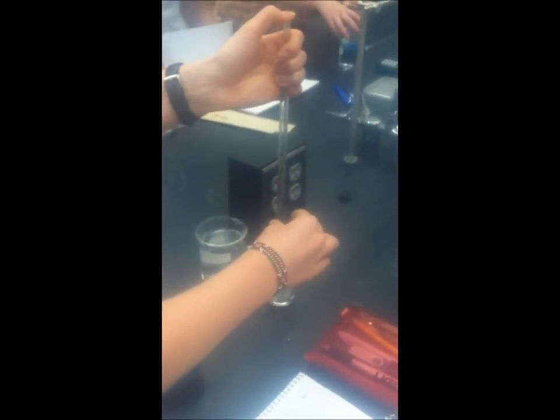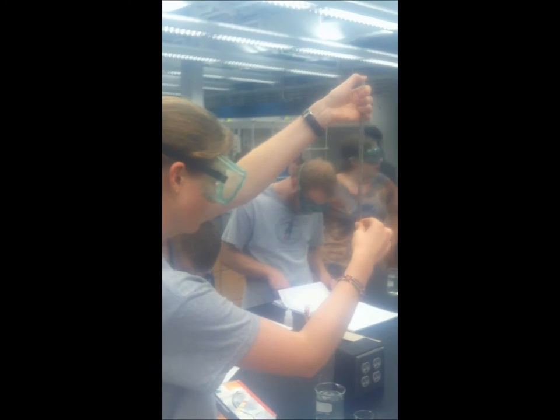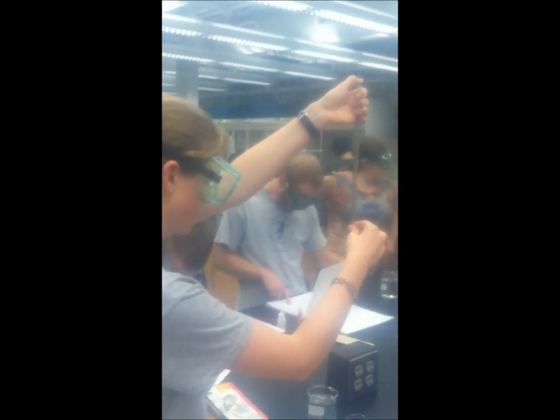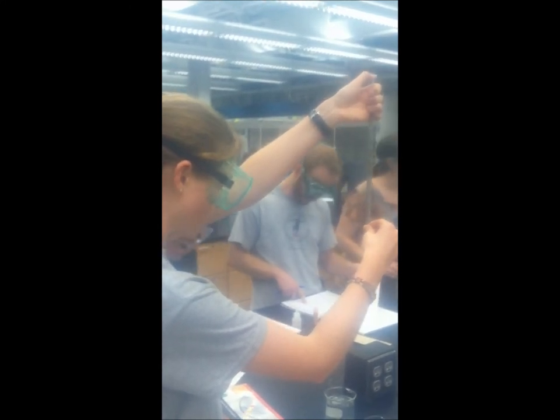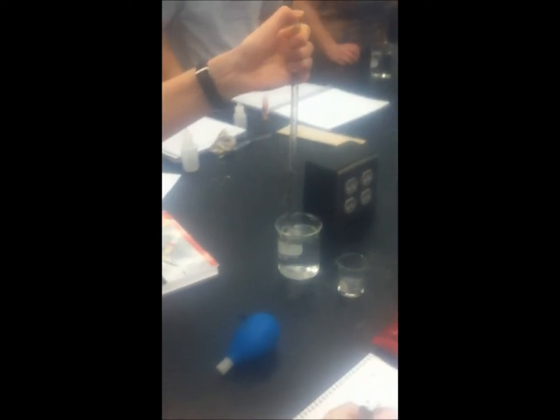Step 3: Empty an unknown volume of water into the second beaker. Get your second measurement of volume from the pipette and put it in the final volume spot on your chart. Fourth and final step: subtract your final volume from your initial volume to get the difference in volume and the volume of water in the second beaker.